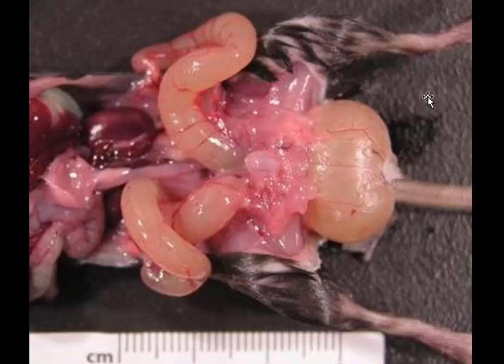This is not male. Whereas rodents have large seminal vesicles, they never get this big. So, we're looking at a very large and fluid-filled uterus. This is mucometra, and that's one of our morphologic diagnoses. Then the question is, what is this? And this is the vaginal vault. The vulva is down here. This is the vaginal vault.